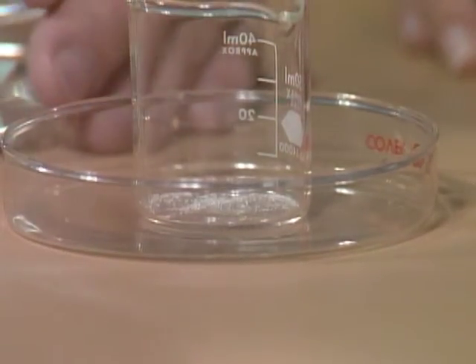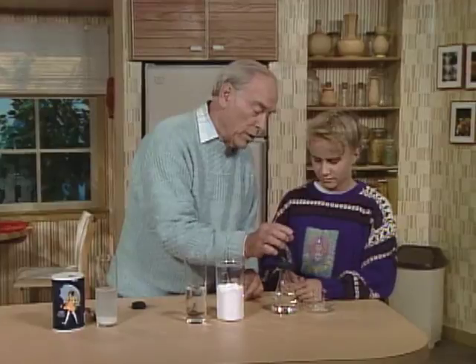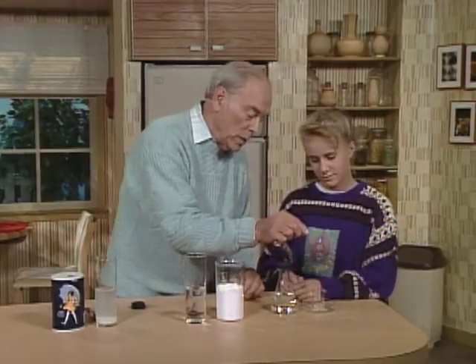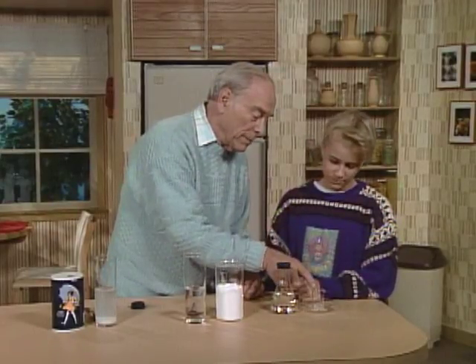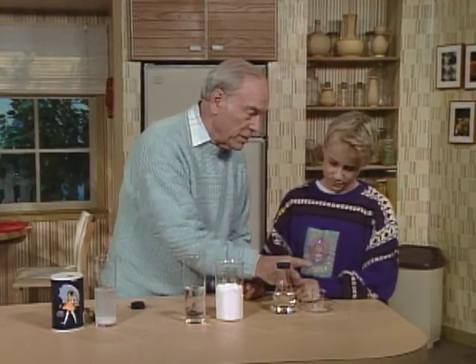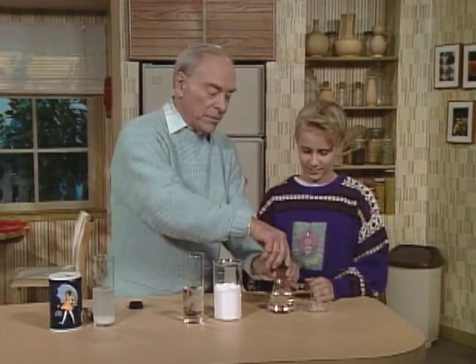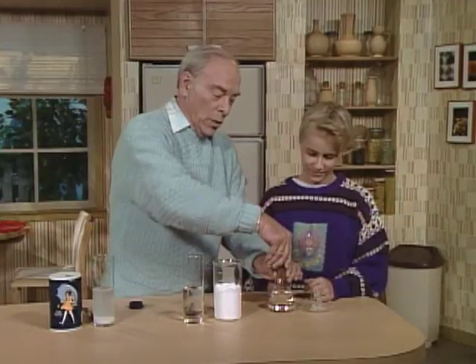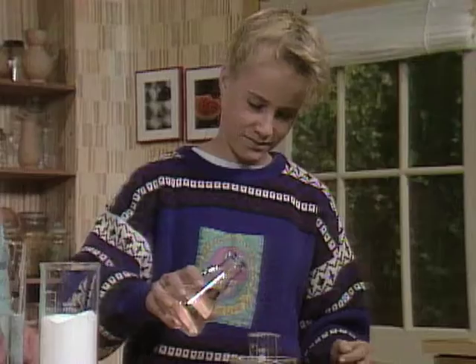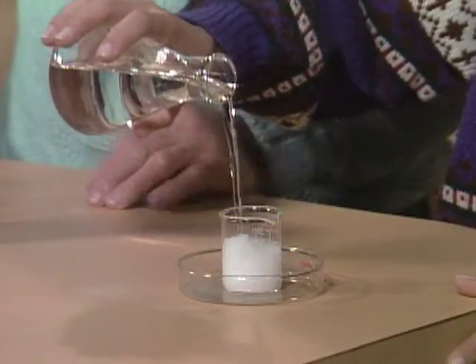Look at the bottom of that little beaker — there are tiny crystals. So as you now pour it in slowly, as soon as the first drop of liquid hits the crystal, it's going to start to solidify. Slowly pour it in there and you will see what happens with this super saturated solution.